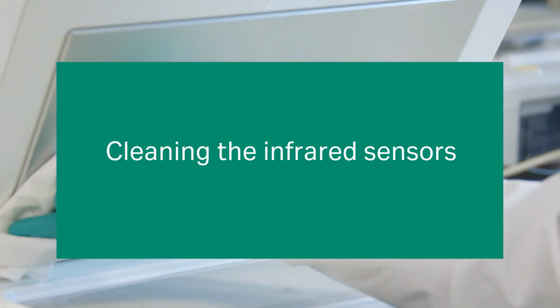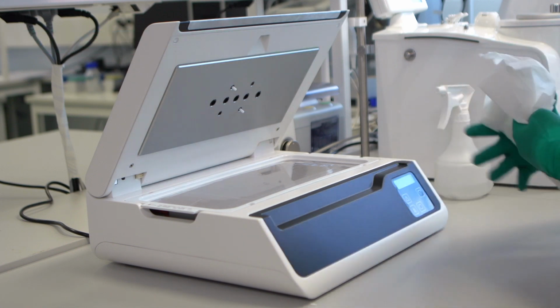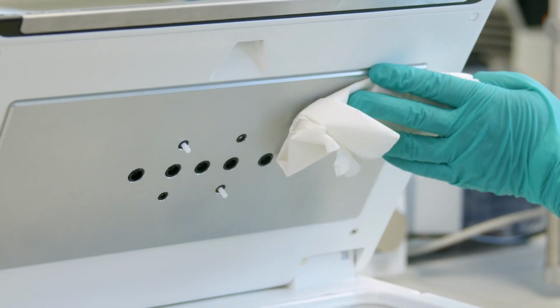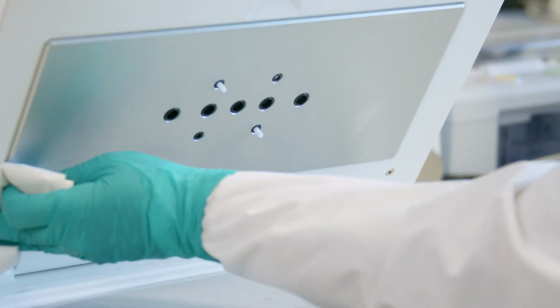It is important to avoid touching the infrared sensors to prevent damage. When cleaning the top heating plate, avoid spraying directly onto the instrument. Instead, spray onto a soft cloth and use it to wipe. To clean the infrared sensors themselves, gently spray with compressed air only.